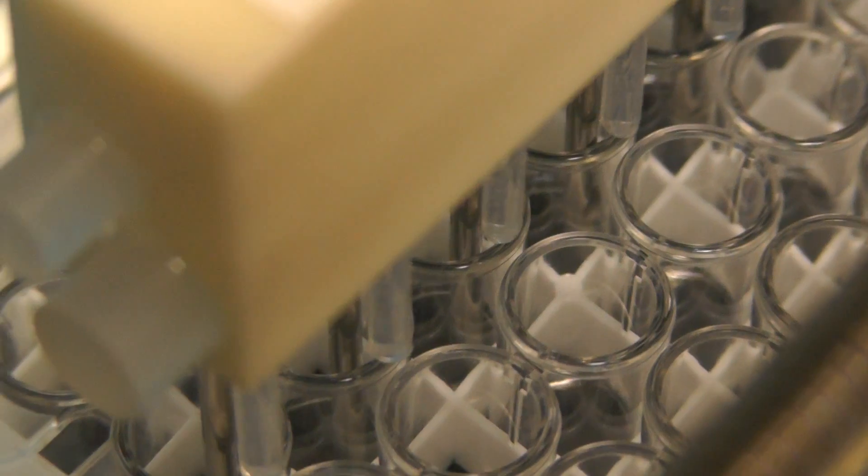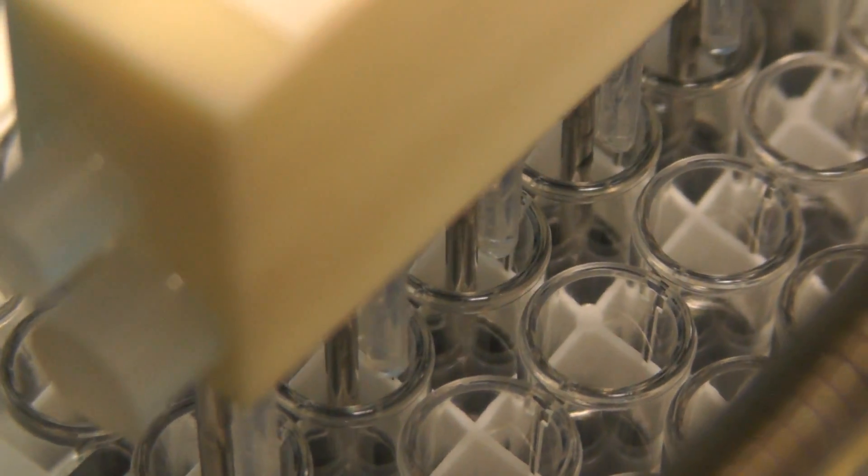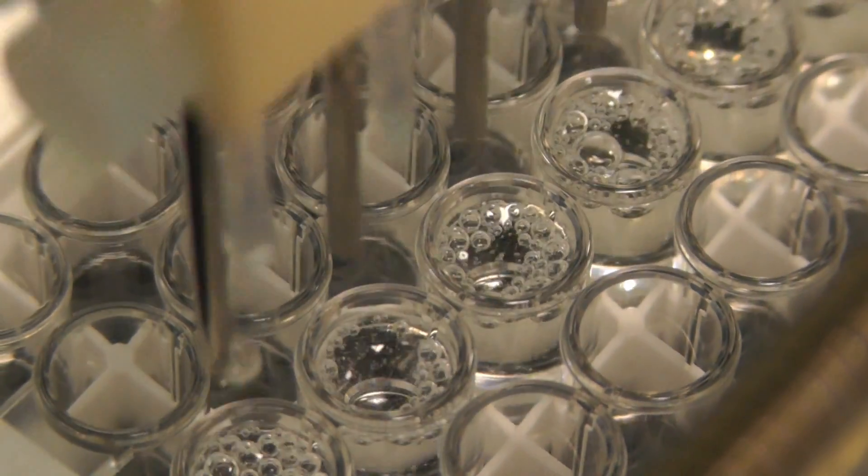We remove unbound analytes by aspirating and washing three times with wash buffer for 300 microliter cycles.